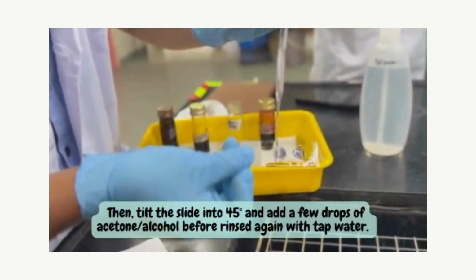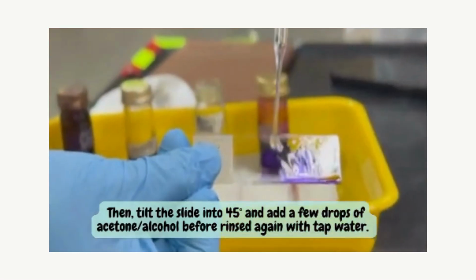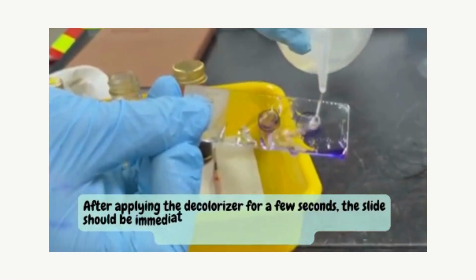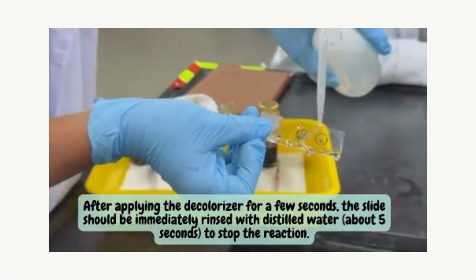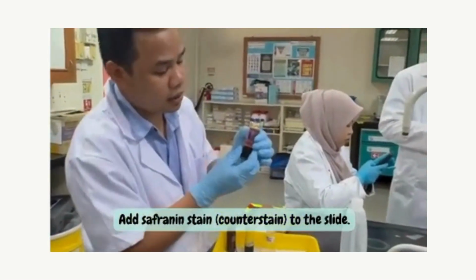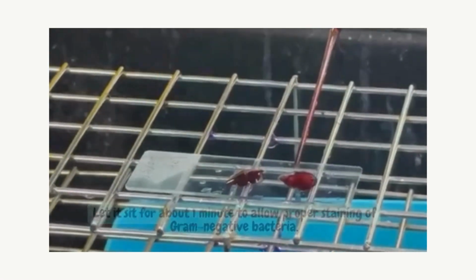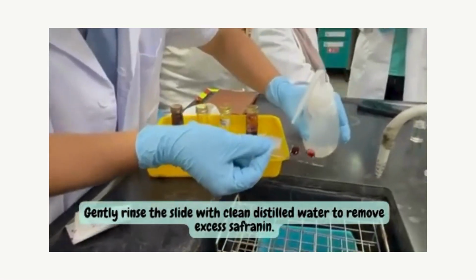Then tilt the slide to 45 degrees and add a few drops of acetone or alcohol before rinsing again with tap water. After applying the decolorizer for a few seconds, the slide should be immediately rinsed with distilled water for about 5 seconds to stop the reaction. Add safranin stain to the slide and let it sit for about 1 minute to allow proper staining of gram-negative bacteria. Gently rinse the slide with clean distilled water to remove excess safranin.